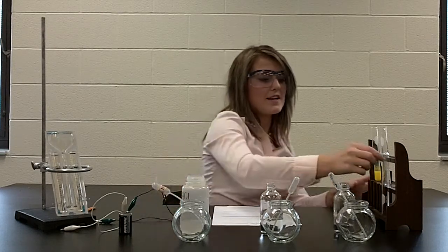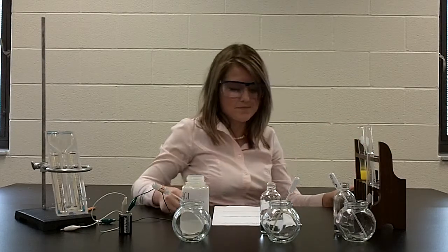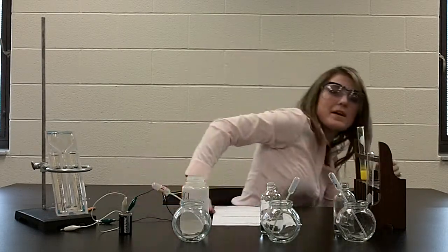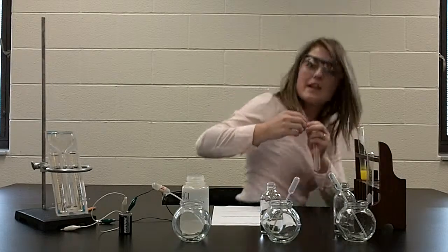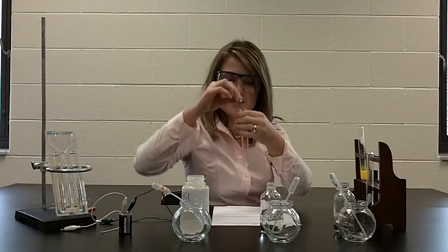We're moving on to Part 3, which is the reaction between an acid and a metal. Again, have your test tube ready for Part 4. It needs to be ready right away. So with Part 3, I'm going to obtain a piece of metal for this reaction, a magnesium metal. And then I fold up that piece of metal so that we have a lot of surface area to deal with this reaction.